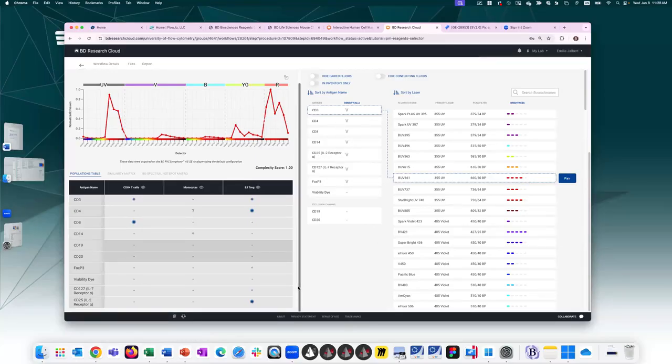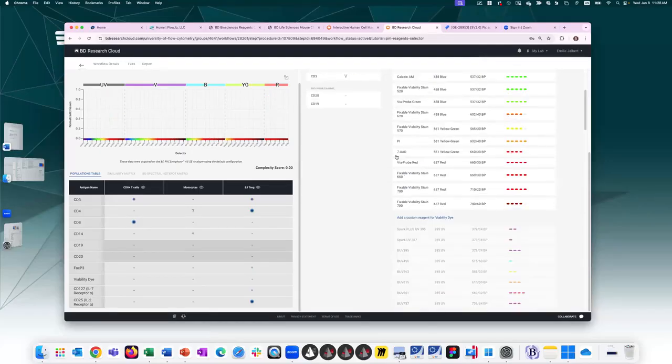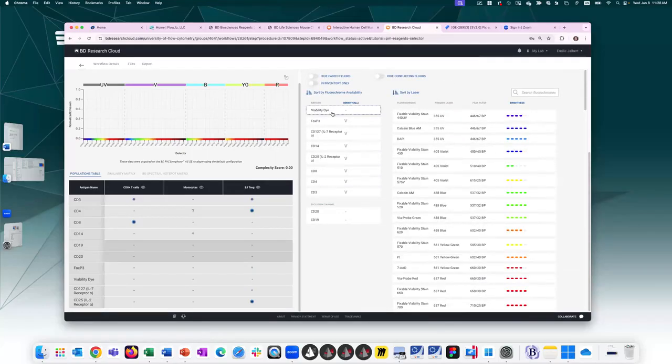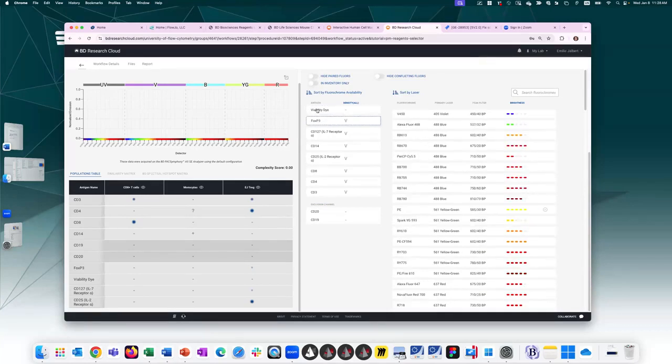You have a list of markers. Typically, you want to start with your most restrictive or important markers first to assign them the best or only options available for those markers. So this list of markers, I can sort them by fluorochrome availability. And I can toggle if it's sorted high to low or low to high. So what this is telling me is that viability dye comes in the fewest colors and CD3 comes in the most available colors. I tend to assign viability dye last because it has quite a bit of flexibility. So I'll just select the next one down the list.